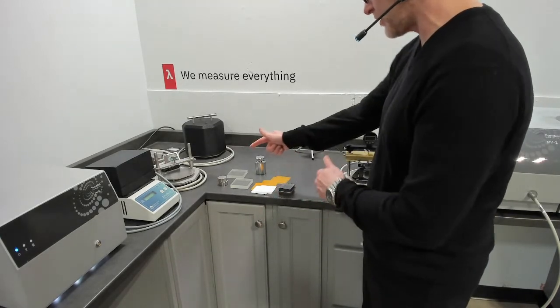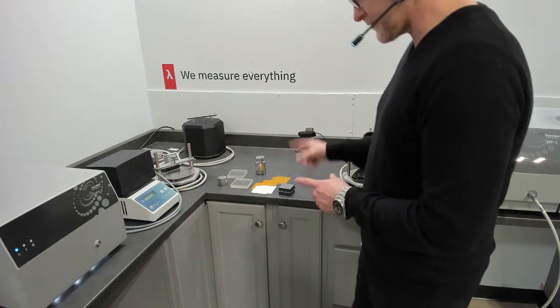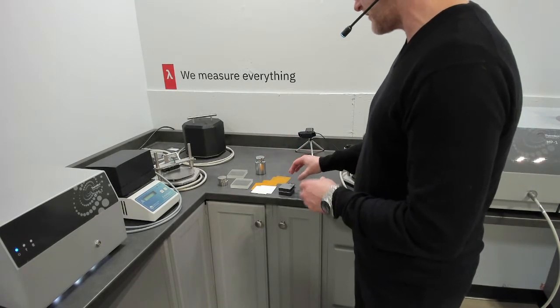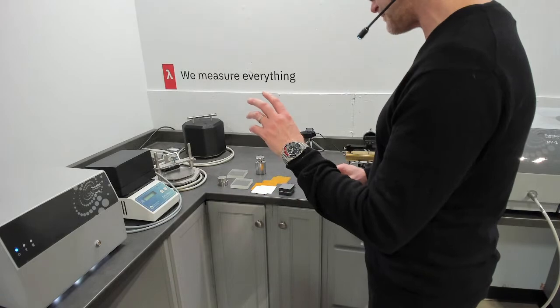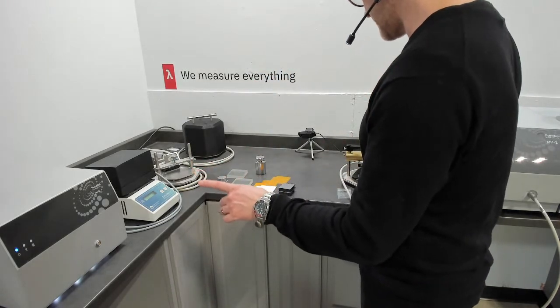That's an absolute approach. There's no calibration. The difference is in the sensitivity of the lower thermal conductivity range between the TPS2 and the MP1.